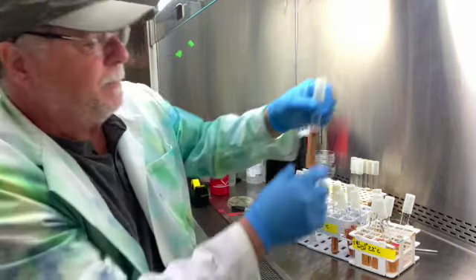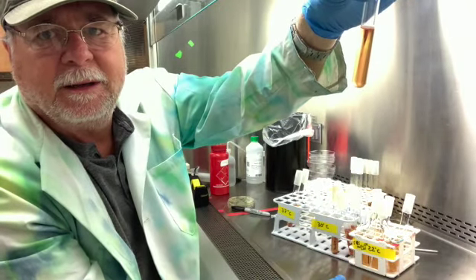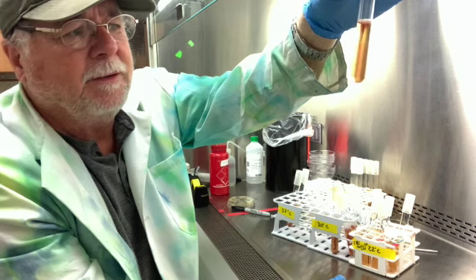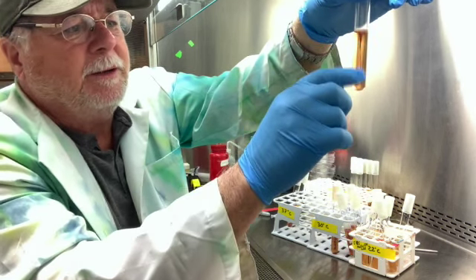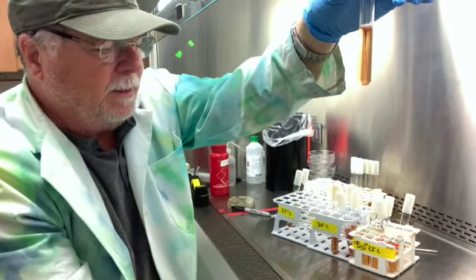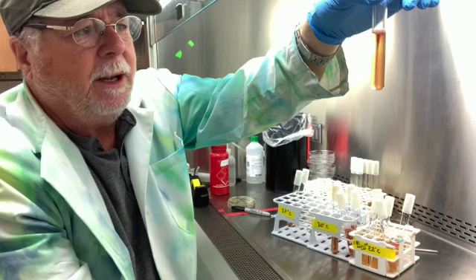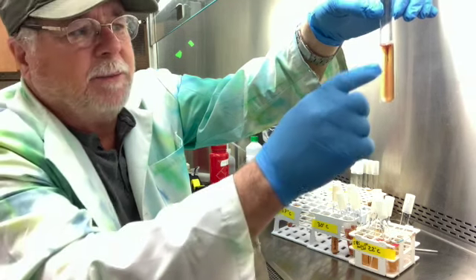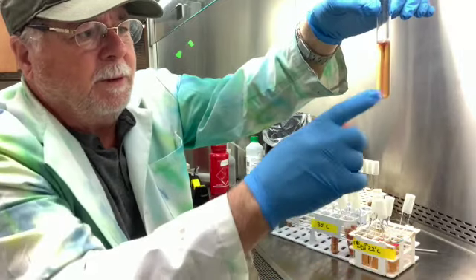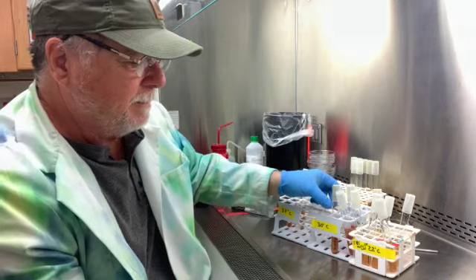Number two is Bacillus subtilis. Bacillus subtilis is growing really well at the surface, and then it doesn't grow very well down below. So it is an aerobe, and it is not motile because it's not expanding out away from the pierce line. So that is Bacillus subtilis.